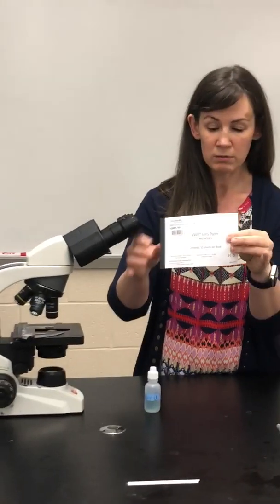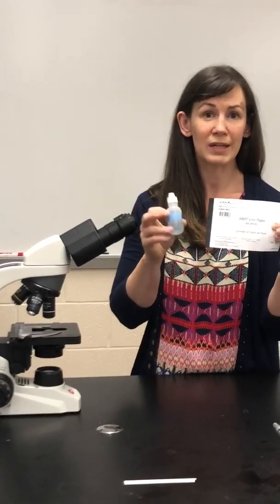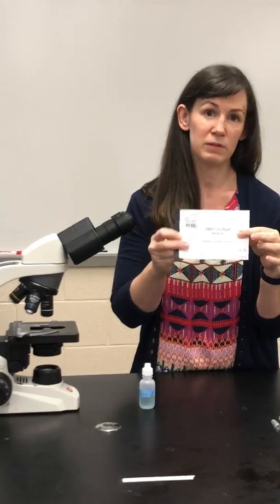To clean your microscope, you're going to use lens paper and lens cleaner. These things are found in the bottom drawer on each side of the lab bench. Make sure you use lens paper and not bibulous paper. There are two different books of paper in there.